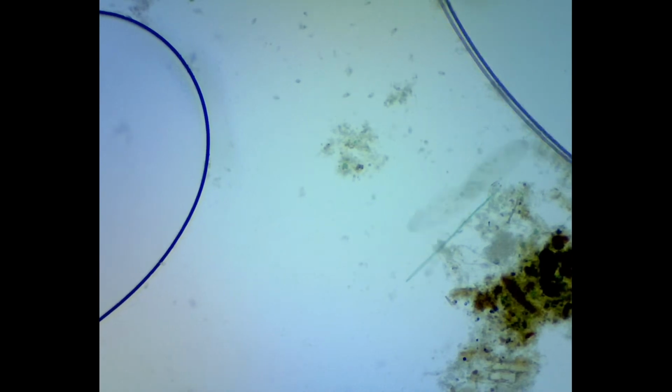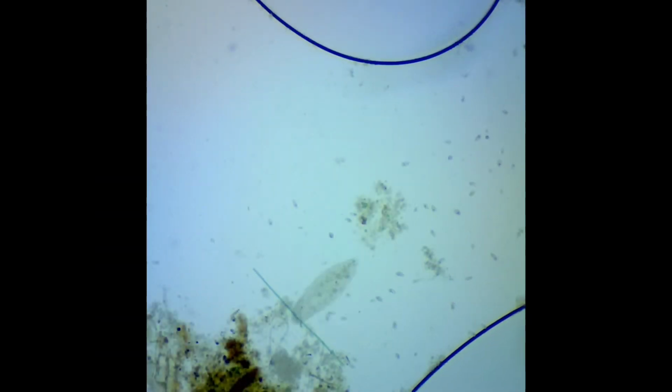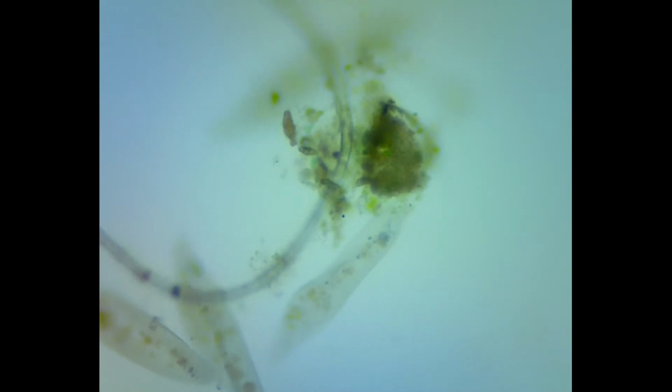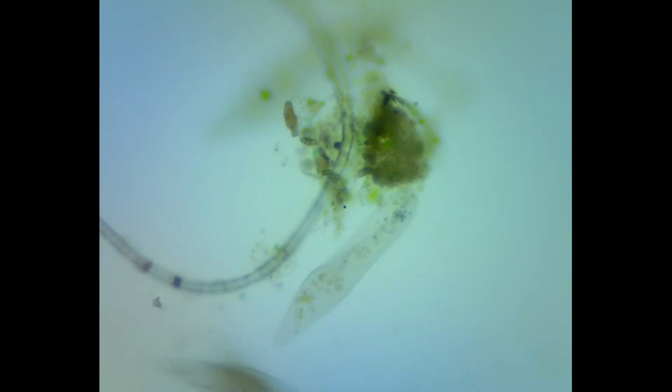It resembles a slipper-like shape and is covered with hair-like structures called cilia. Cilia have important functions for movement through the water and ingestion of food. They cannot change their shape because of their thick outer membrane. This thick outer membrane is called pellicle.